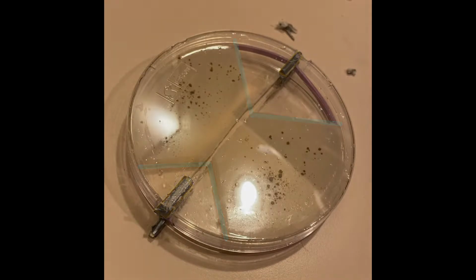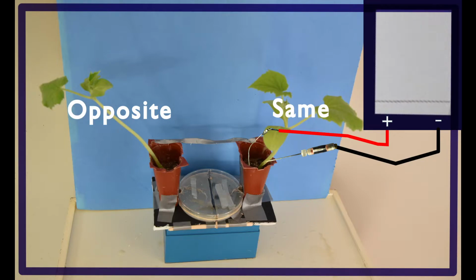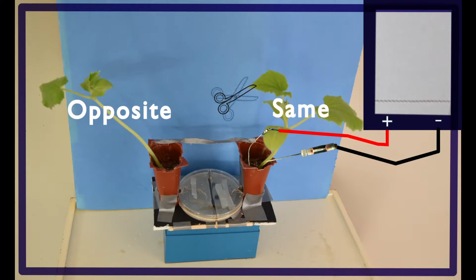Now that we've talked about the protocol for testing this setup and the methods we use to control for electrical conductivity and isolation, we want to talk about what we would like to see when testing the setup. On the same side, when we nudge the leaf, we'd like to see little or no response at all. When we do a soil touch on the same side, we might like to see a small depolarization. This helps us ensure that our setup is recording something. And when we do a leaf snip, we would like to see a large, rapid depolarization. This would mean that our setup is measuring at least in the same plant properly.